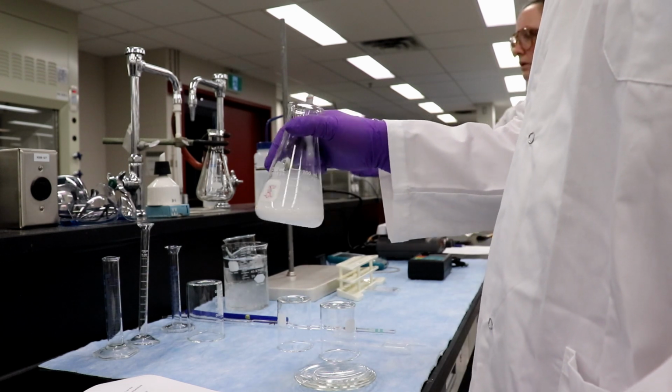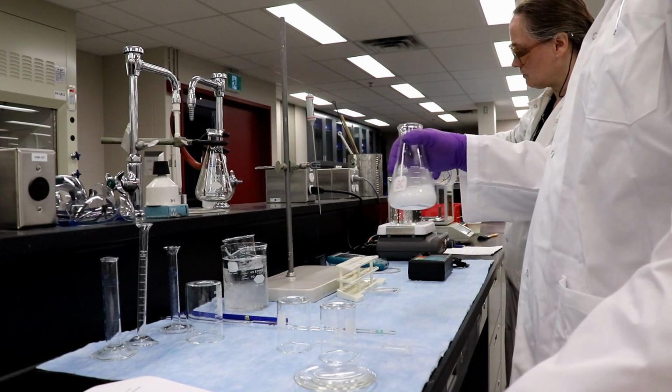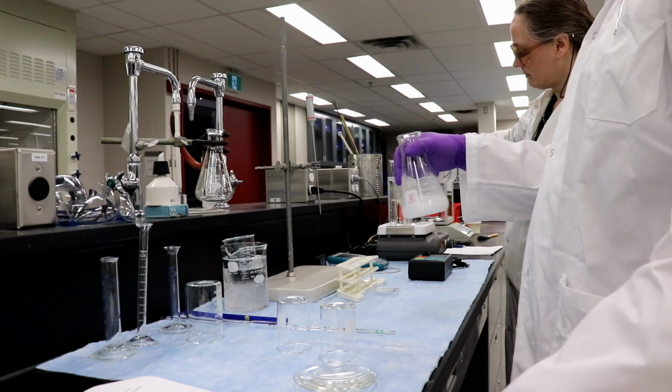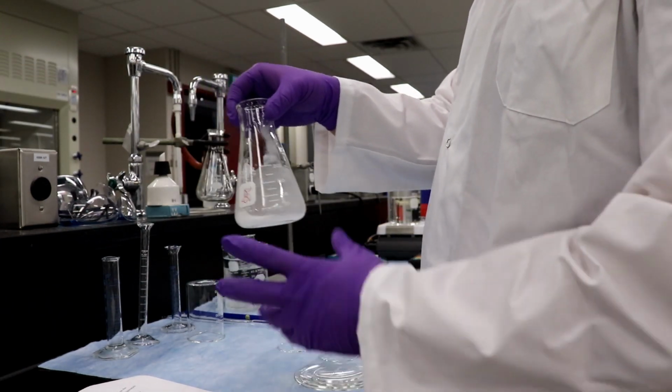gently swirling occasionally. I see why you said fill it up. Because it's supposed to sit in the water. I thought it was supposed to be just above the water. No. Actually in it? Yeah. Go a little bit higher. There you go. That's good. Okay. So we're just going to keep mixing this.